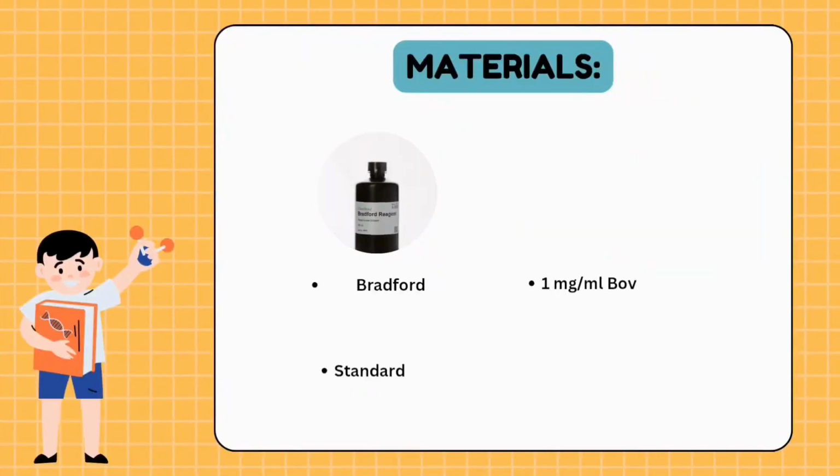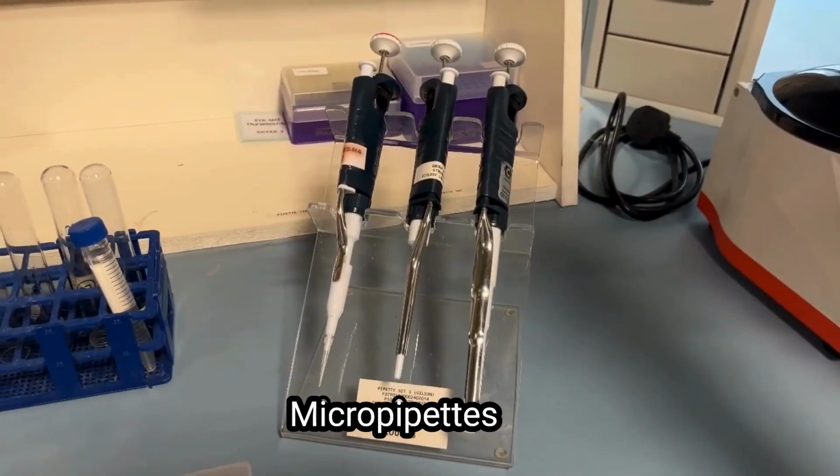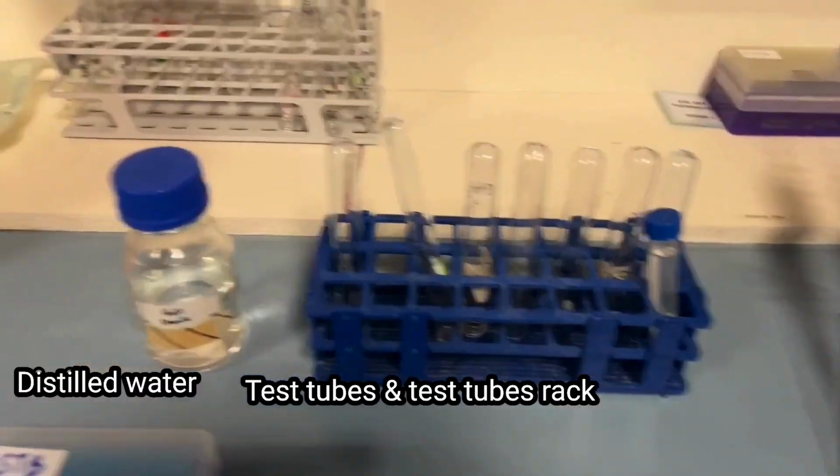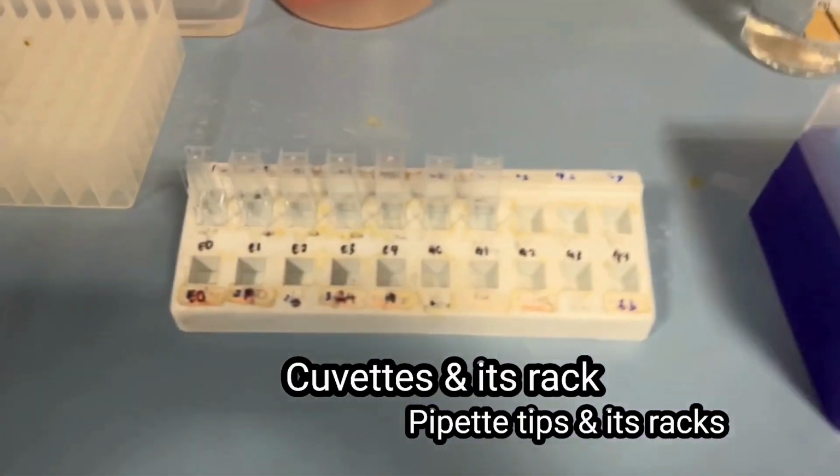The materials used in the experiments are Bradford reagent, 1 mg per milliliter bovine serum albumin (BSA) protein standard, unknown protein solutions A, B, and C, micropipettes, test tubes and test tube racks, distilled water, pipette tips and their racks. Last but not least, cuvettes and their racks.